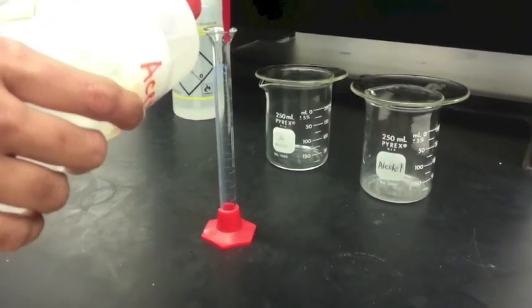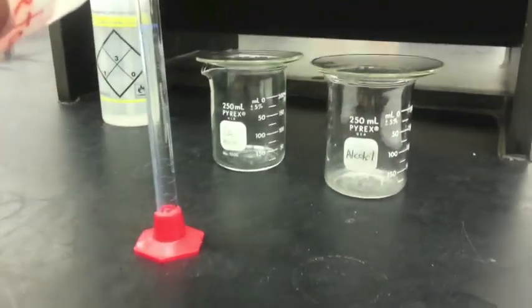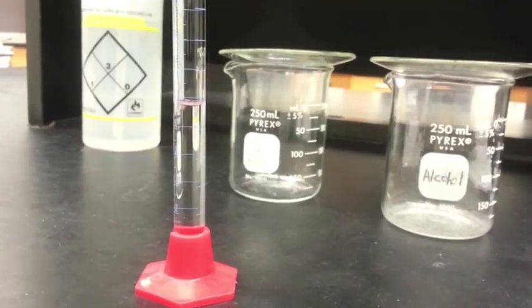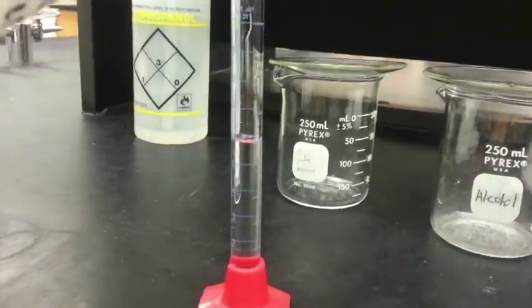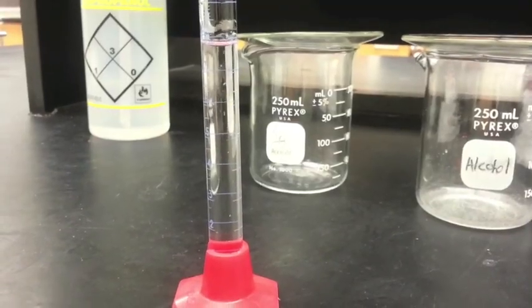Carefully prepare the mobile phase by mixing the solutions as instructed. Use the correct volumes and mix the solutions very well.